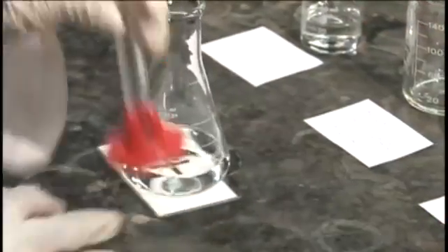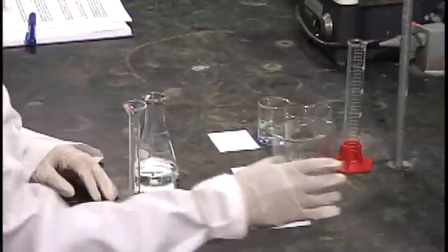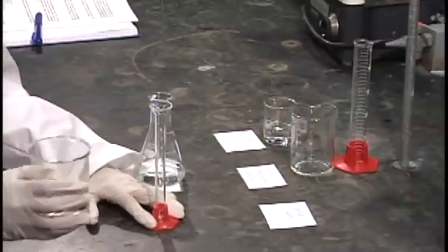Then using a different graduated cylinder, we measure out 5 milliliters of distilled water.